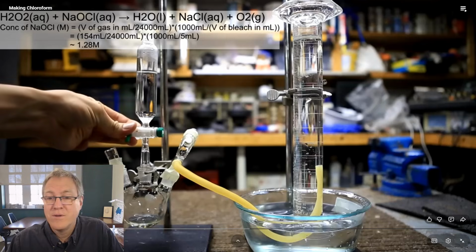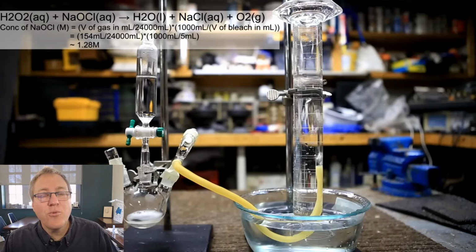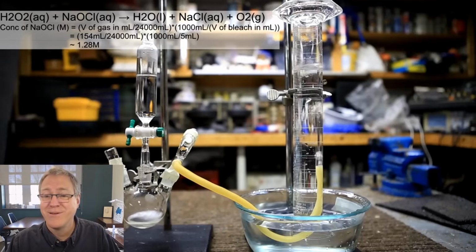As shown in the equation above, the hydrogen peroxide reacts with the sodium hypochlorite to form water, sodium chloride, and oxygen gas. Let's just go backwards a bit. I was expecting little fizzy bubbles, and those are big glug bubbles. Reacts with the sodium hypochlorite to form water, sodium chloride, and oxygen gas.